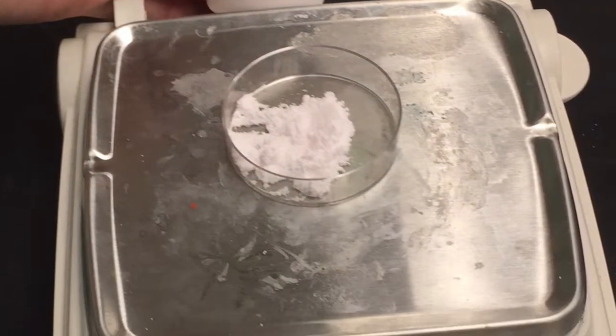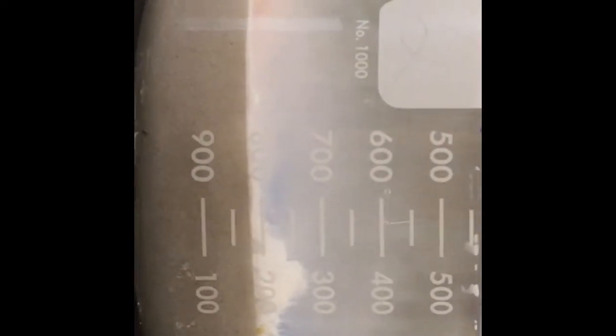Step 13. Measure out 2 grams of the manganese 2 sulfate. Step 14. Pour the 2 grams of the manganese 2 sulfate into the solution of the sand, sodium silicate, and distilled water. Then watch what happens. Also note how the cobalt 2 nitrate, iron 3 nitrate, and magnesium nitrate have grown and formed.